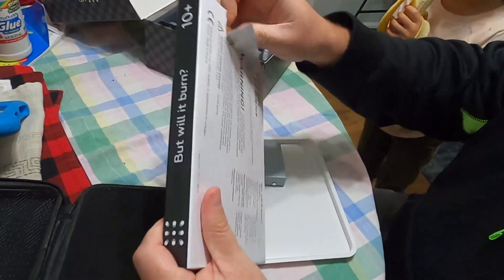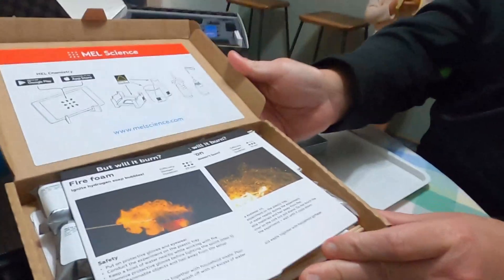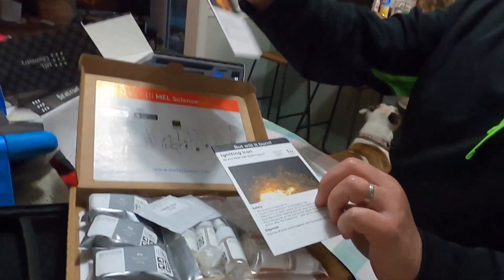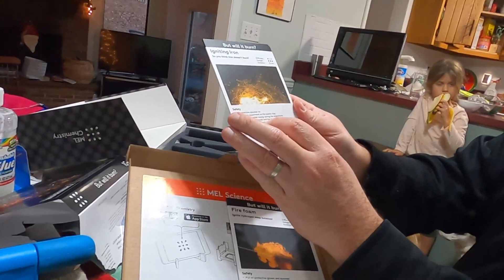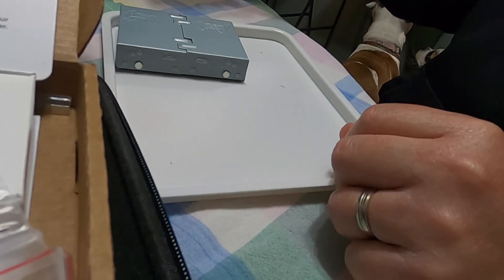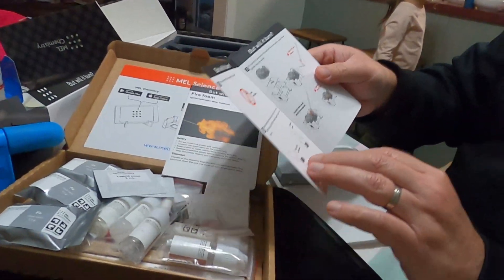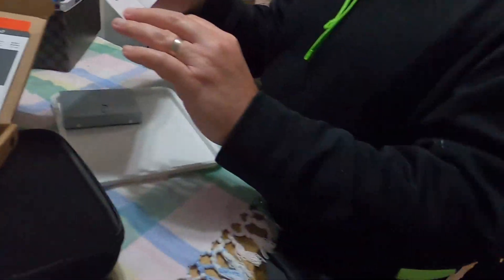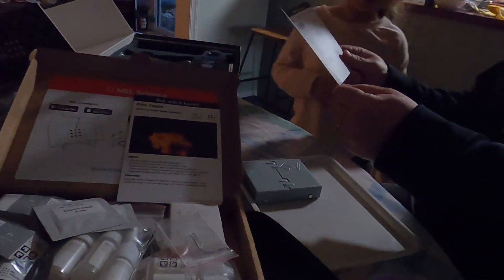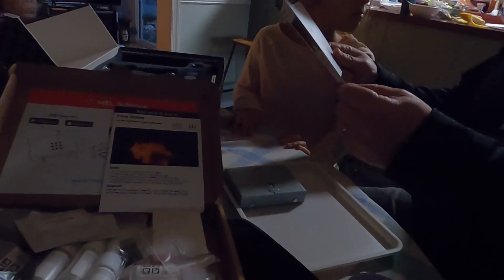I think we finally used this thing. I have my protective eyewear on. On the plastic tray — yeah, we got the plastic tray. Keep a bowl of water nearby during the experiment. Who can get a bowl of water? This experiment looks better in the dark — dim lighting. Luckily it's not bright out. Dim out one of the lights. Steel wool, also known as iron wool, is made of fine iron threads. Fluff the wool up a little bit to make it easier for oxygen to access the iron.